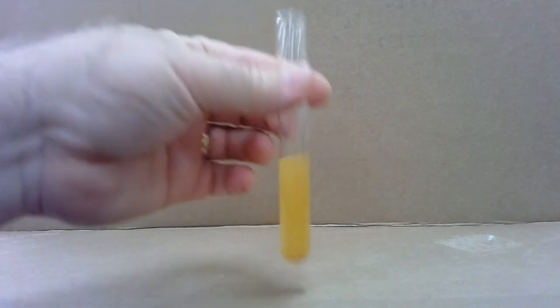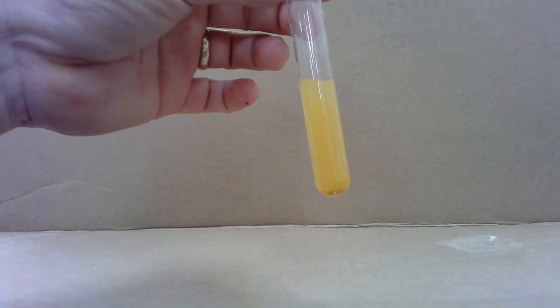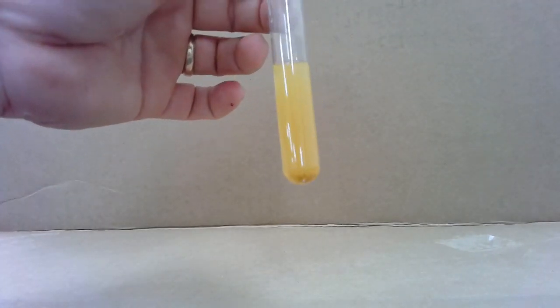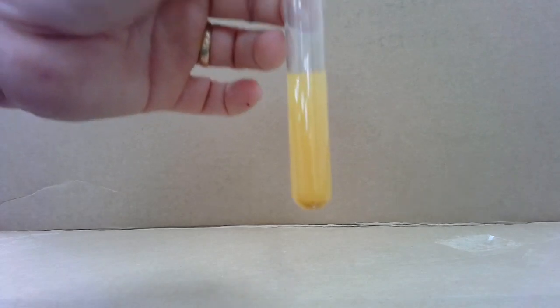Alright, let's see what else we can do. Remember the red food coloring was just to make it a little more visible. Here I have a solution of iron 3 chloride. It's kind of a rusty color. You can see some of it is stuck down there in the bottom. That's just a result of it being kind of old.